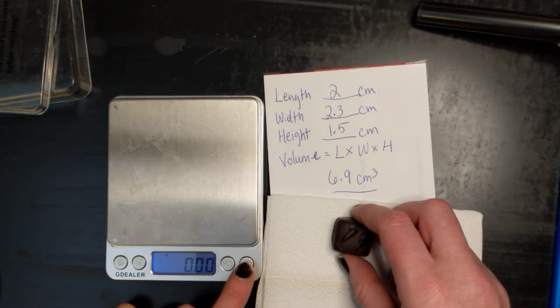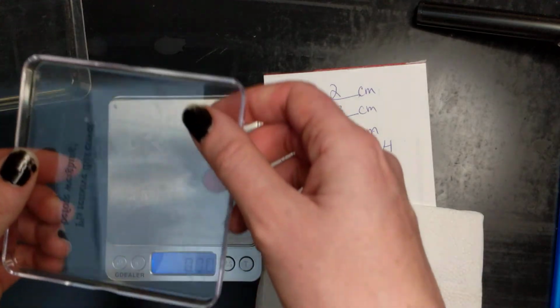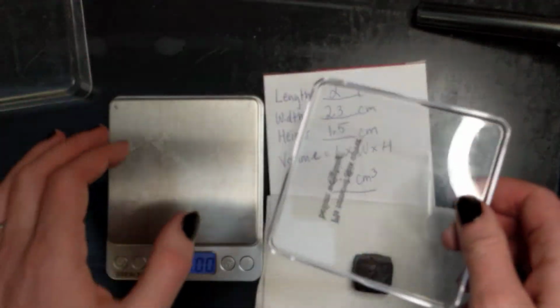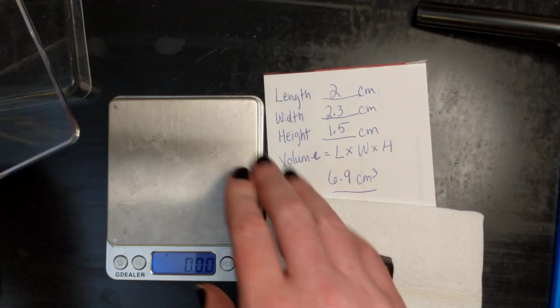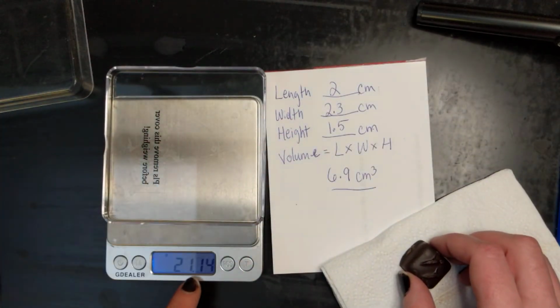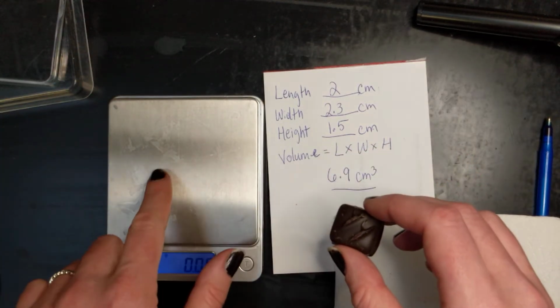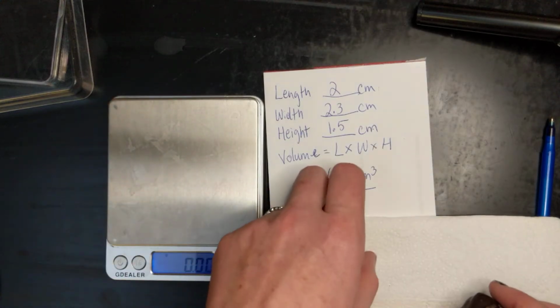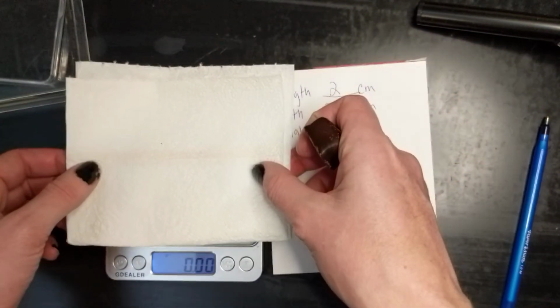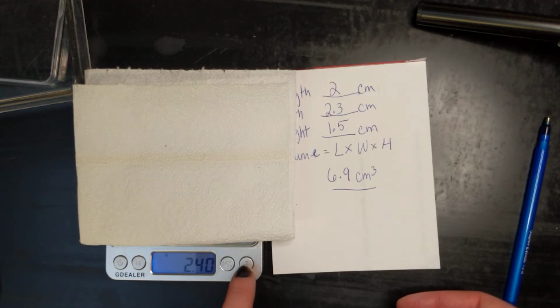This is the tare button, and this zeroes out the balance. What I would need this for is if I put some sort of beaker or container, or maybe like this paper towel, on here, but I don't want the mass of the paper towel, because anything I put on there, it's going to give me the mass of that object. I just want to find the mass of this, but I don't want to put it directly on the pan. So this is the pan. Let's put the paper towel down first, and you can see it gives me a mass right here. This is very sensitive: 2.40. And I want to put it back to 0.